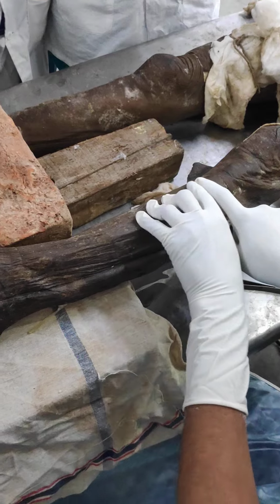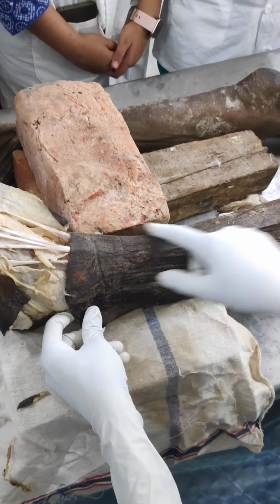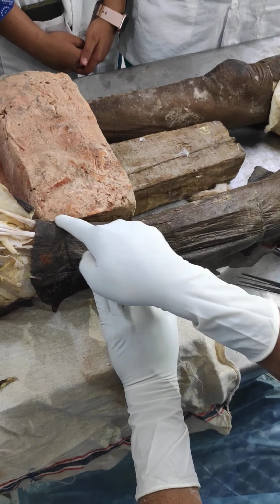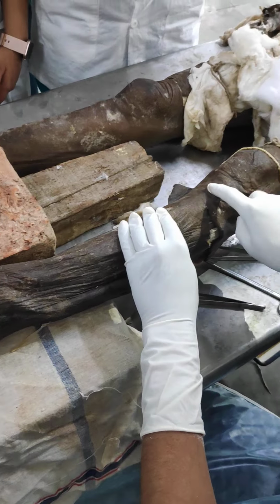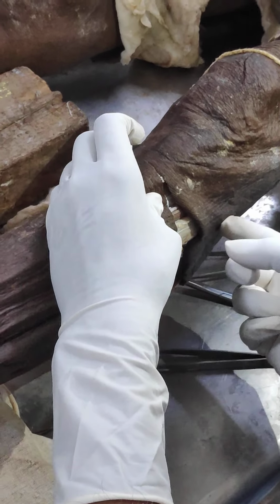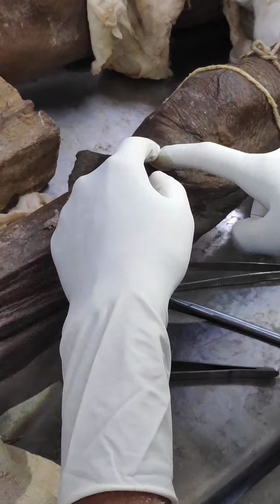First I want to tell you, someone has done this dissection but not in a typical window way. The incision is not done in a typical way, but I am telling you the typical way of dissection. First you see the anterior border of the tibia. Going upward, you see the tibial tuberosity. Going further laterally, you can feel the neck or head of the fibula. So our incision site will be from the tibial tuberosity.